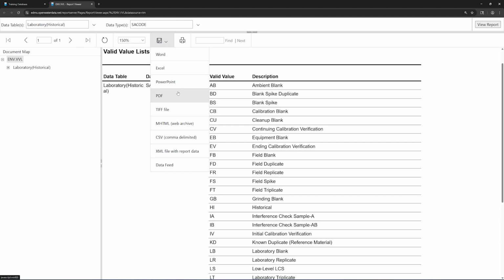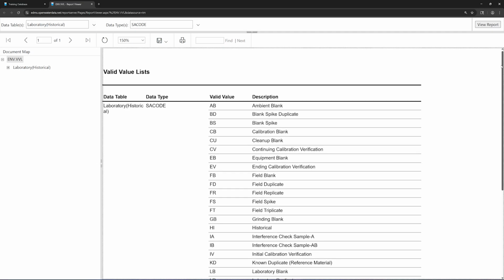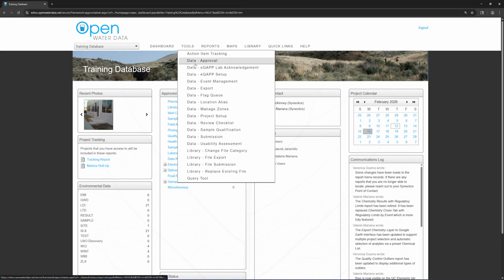Along with using valid values to create your EDD, you will need to make sure to use the sample names provided on the chain of custody and the location names, or loc IDs, in EDMS associated with those samples. The contractor will enter the sample IDs into a ChemField file in the database, which is a digital version of the COC. If there is a mismatch between the sample ID they use and the sample ID you use, you will get an error. If handwriting is unclear, reach out and confirm the sample ID to avoid running into errors later on.